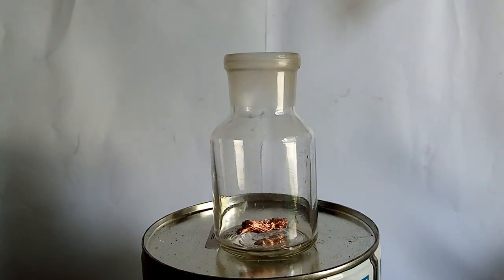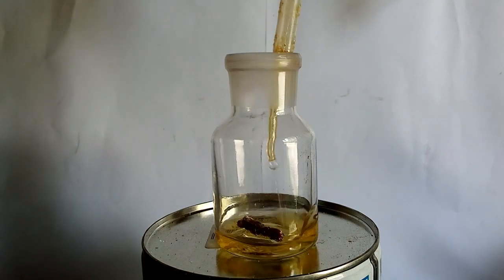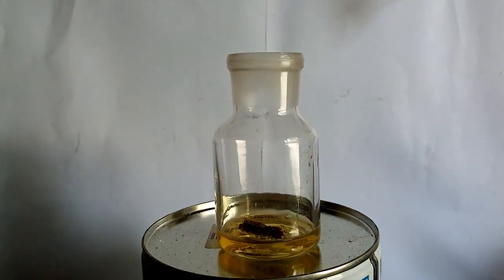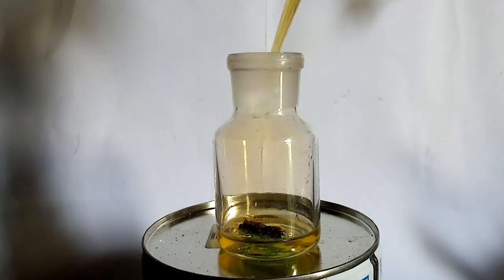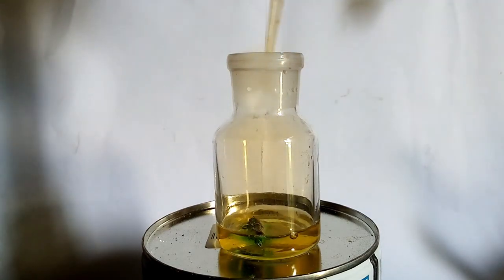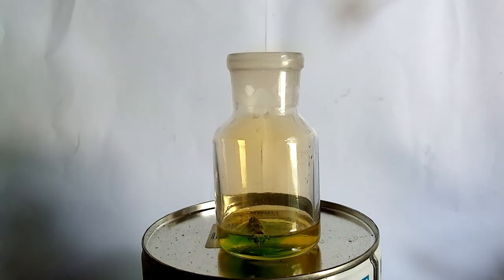The nitric acid should react with the copper, forming copper nitrate. Because it reacts, this confirms the product.